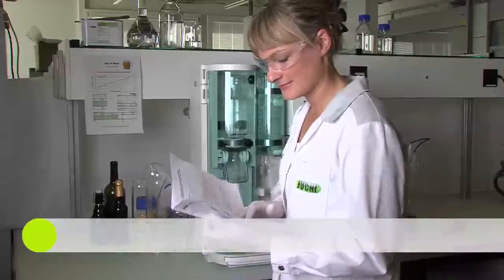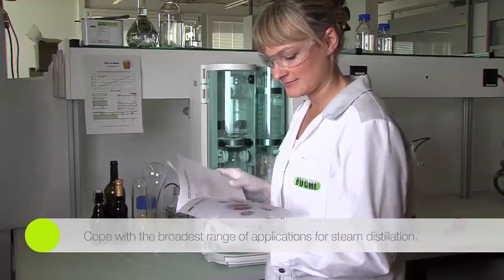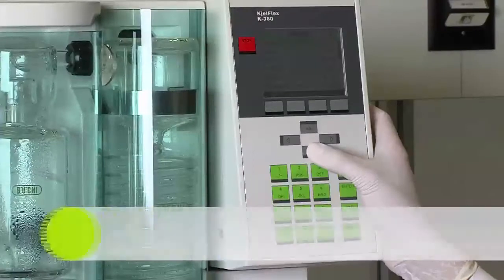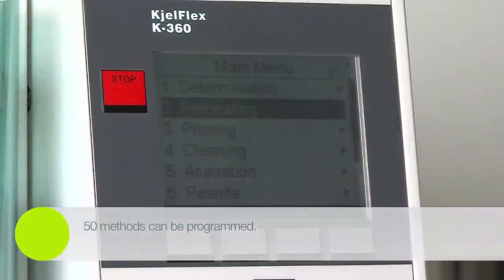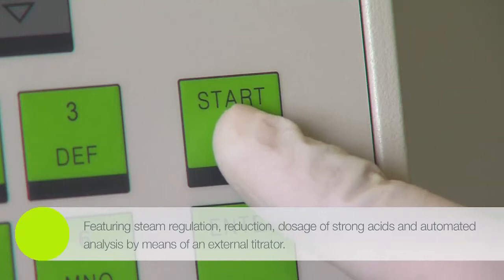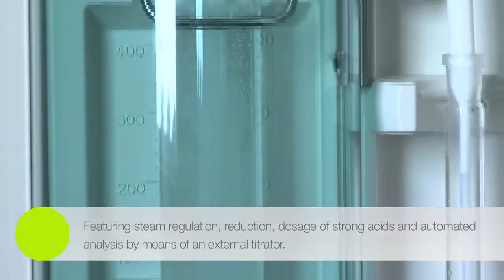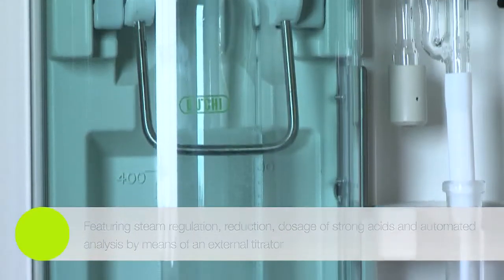Food, feed, environmental and pharmaceutical laboratories are keen to perform steam distillations in the most flexible way. 50 methods can be programmed for various sample matrices featuring steam regulation, reduction, dosage of strong acids and automated analysis by means of an external titrator.